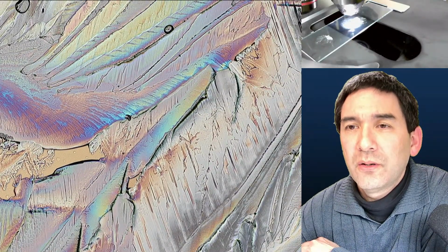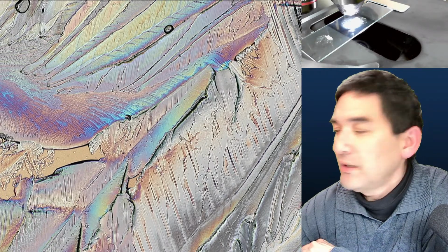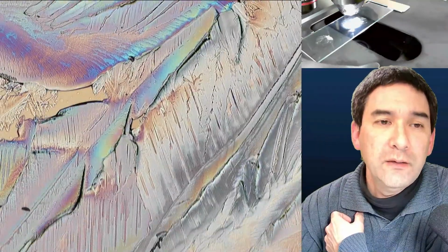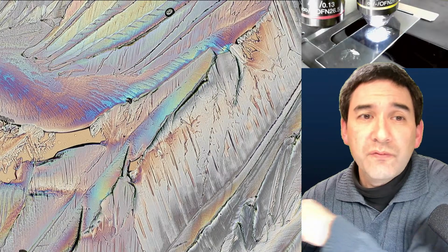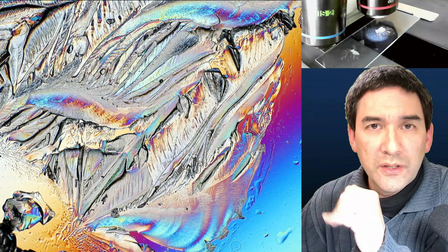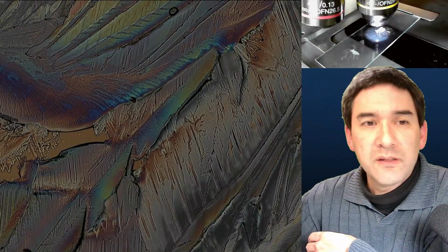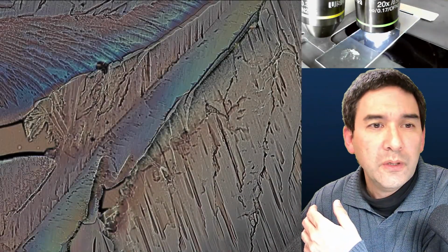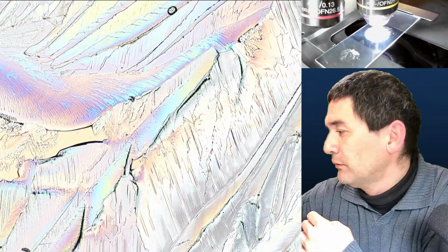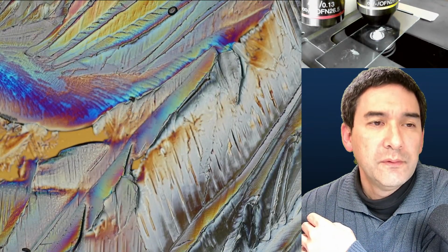So what is the visible magnification for crystals, bigger ones, so that I can use Olympus 40X? Would I see anything? Well, I'm using right now the 10 times objective. For crystals, actually, you should only use very low magnification. Even 4 times is often enough. The reason is because some of the crystals are fairly thick, and you do want to have a proper distance between the objective and the microscope slide. Going up with the magnification really doesn't add a lot. I mean, this is now more than 20 times, and you don't really gain a lot because you're kind of losing a little bit the overall appearance. I've had to put in the condenser again.